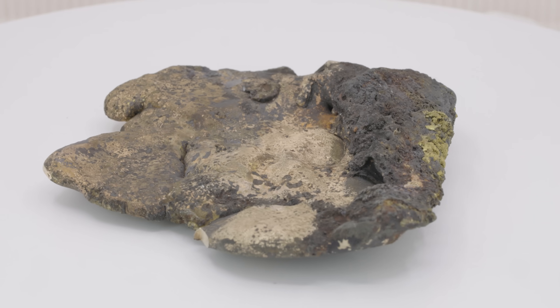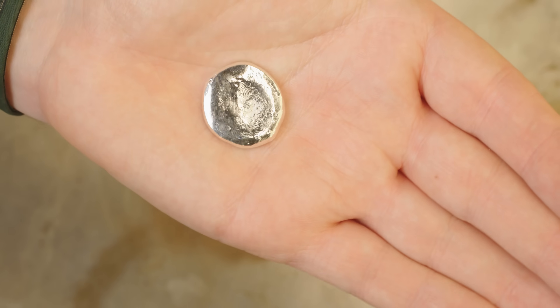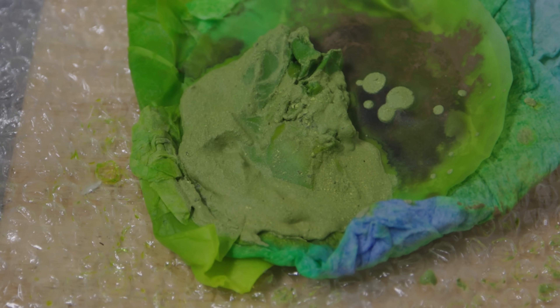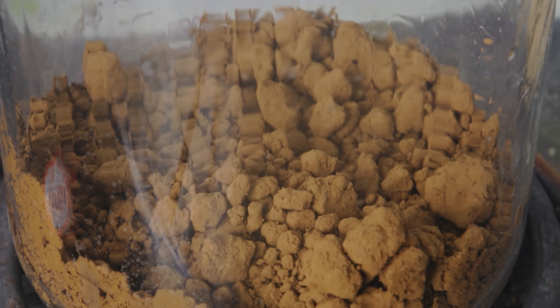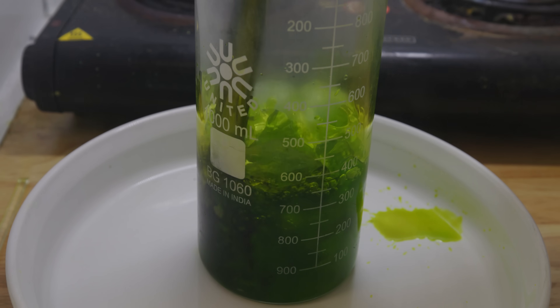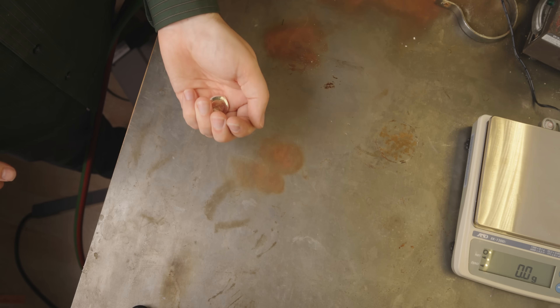I present to you pure silver and its beautiful sheen. This is one of those moments where I just feel so much joy in the journey and gratitude that I was even able to learn something new. The final weight: 25 grams. A nice haul, though I can't help but feel like maybe I could have achieved a greater yield if I paid more attention to preserving the silver chloride during the gold refining process. I was just so laser focused on the gold that I feel like maybe a little bit of silver got away from me. All that being said, I'm incredibly happy that I was even able to work through the silver refining process successfully.